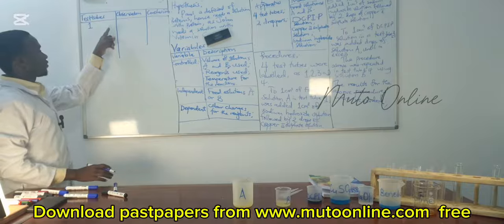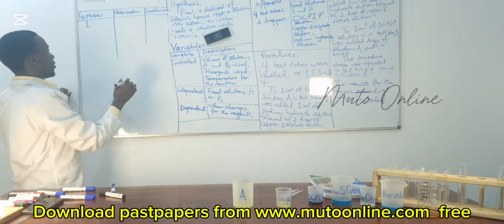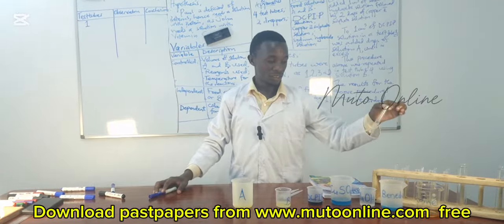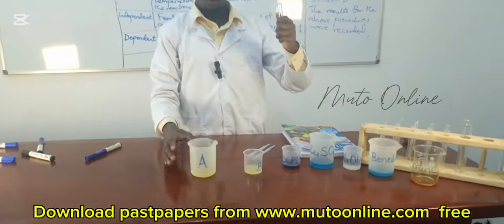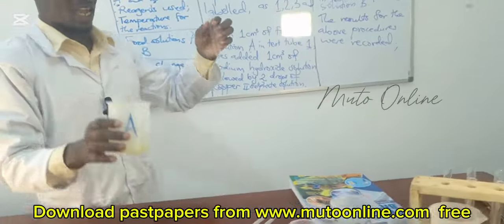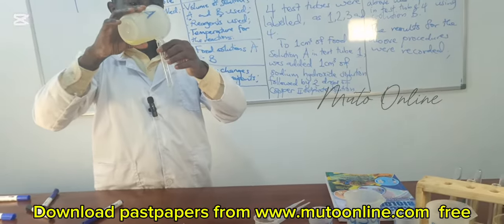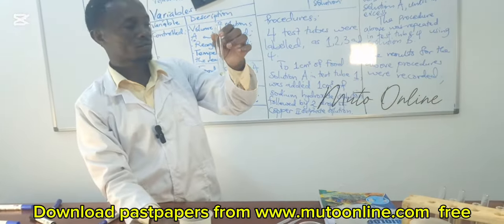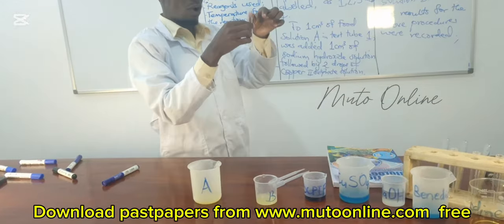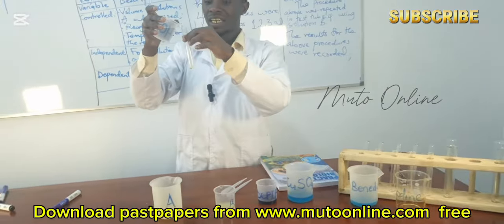Like the way you stated it in the procedures, we are going to carry out the tests in test tube 1. If this is our test tube 1, we said that 1 cubic centimeter of A, I'm going to add 1 cubic centimeter of sodium hydroxide, equal amount of sodium hydroxide.